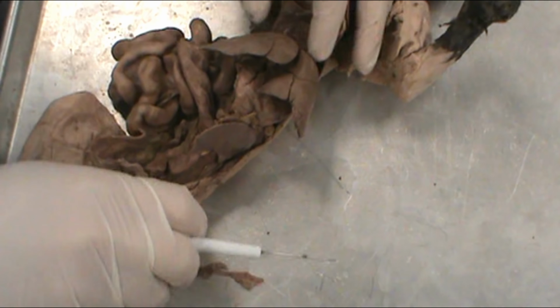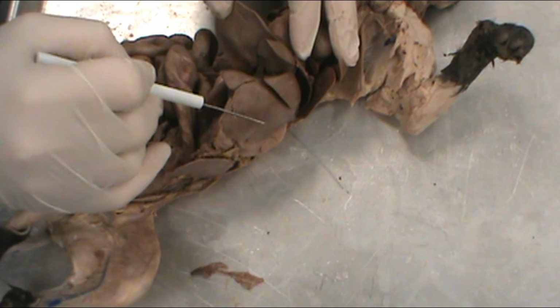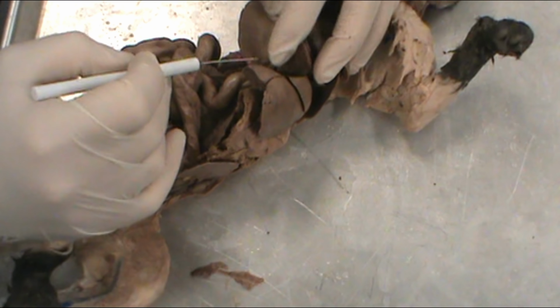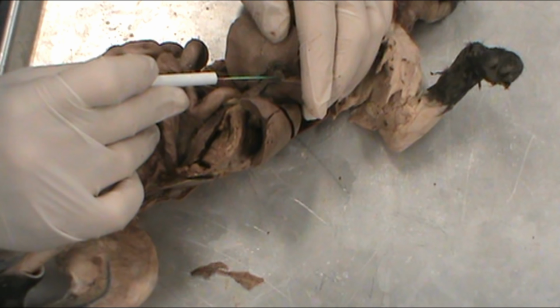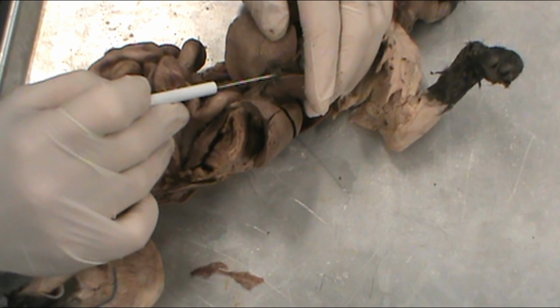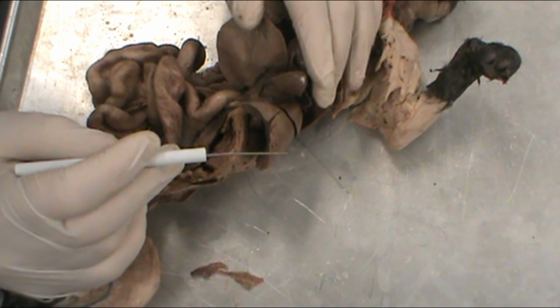Moving on down through the body, all of this organ mass right here, this is the liver. And so you have 1, 2, 3, 4 lobes, large lobes, and some smaller lobes of liver over here. And nestled in between the lobes of the liver, we have the gallbladder, and that would be this greenish colored membranous sac right here. This is the gallbladder, and you can see the bile duct as it comes down. These are both accessory organs to the digestive system. Remember, the liver makes bile and the gallbladder stores the bile.